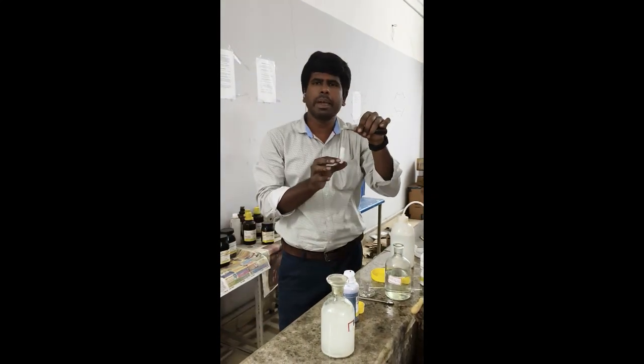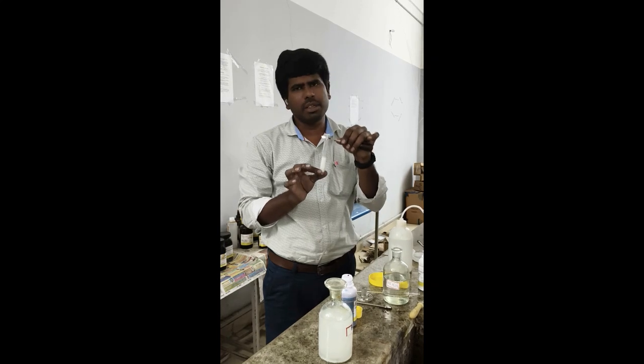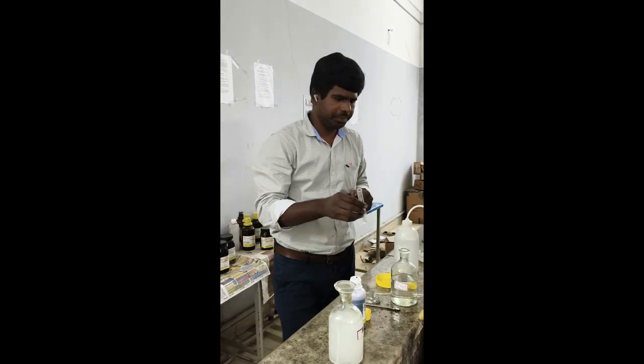So we confirmed magnesium cation and the sulfate anion. So our salt is magnesium sulfate. Clear?